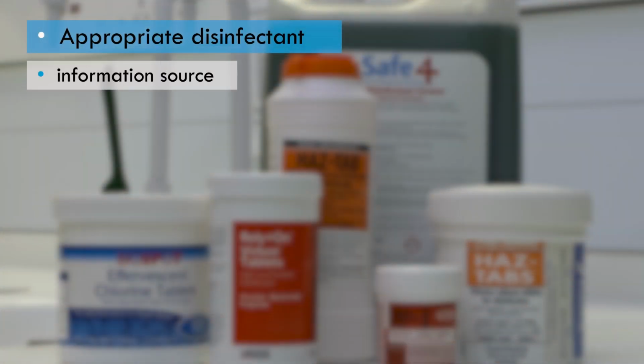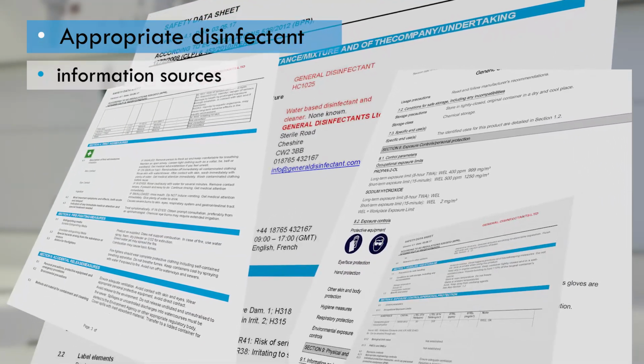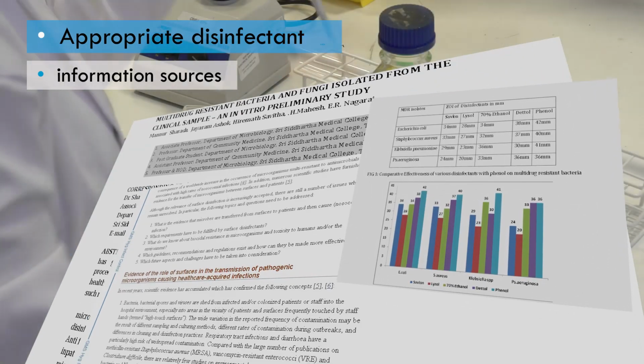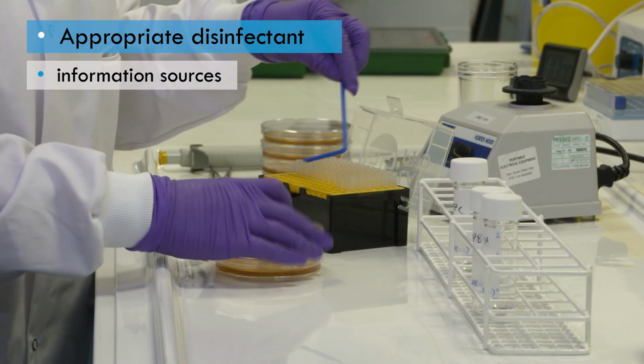You will need to gather information to help you decide which disinfectant to use. This can come from product test data supplied by the manufacturer of the disinfectant, peer-reviewed articles, and in-house testing. A combination of information from these sources would provide the most confidence in assessing the disinfectant's effectiveness.